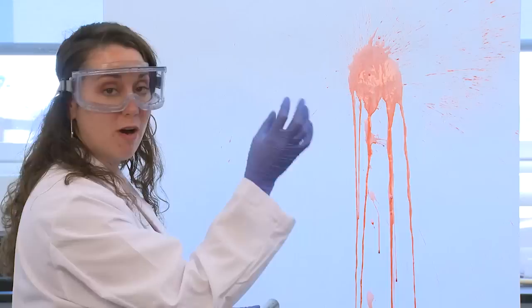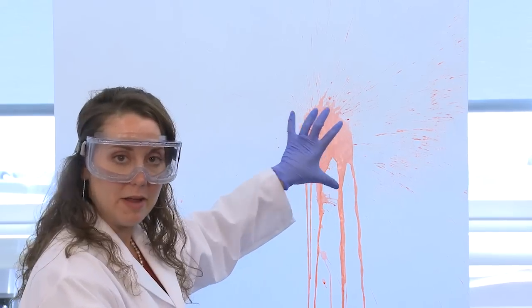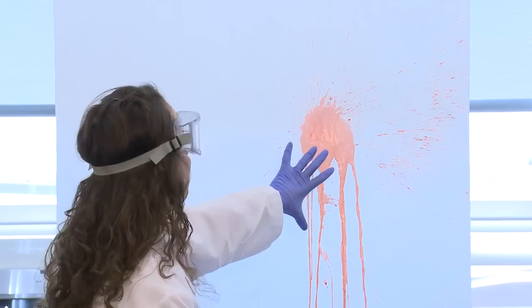With every single heartbeat there's going to be one new arterial spray pattern. We can see the location where the blood hit initially, and then as the blood runs down due to the large volume, we can also see the really large, spiraling spray pattern that comes out from all around the main area where the blood hit.